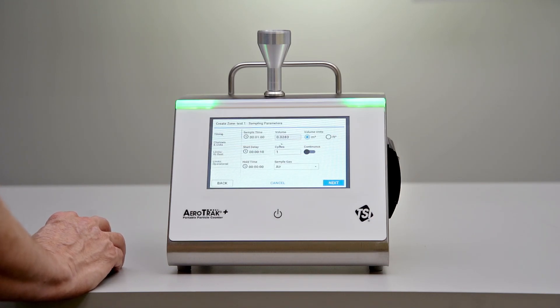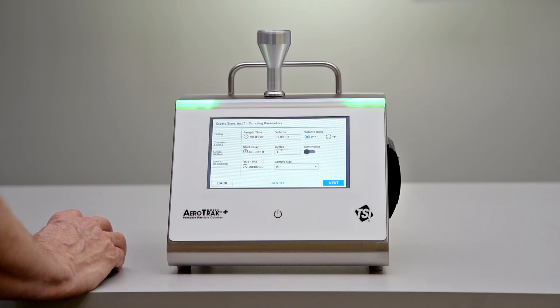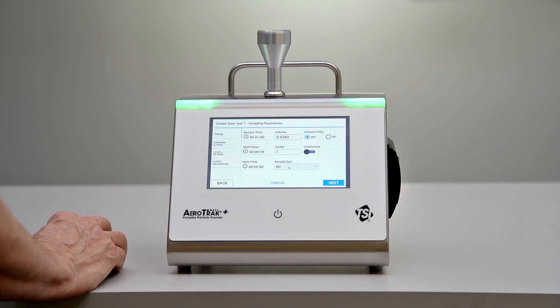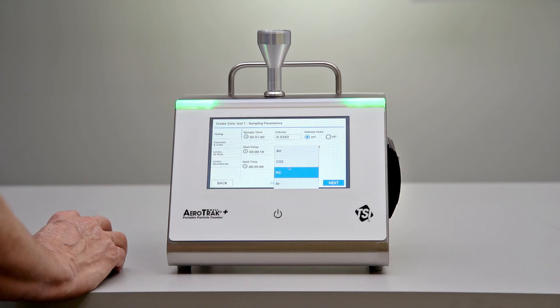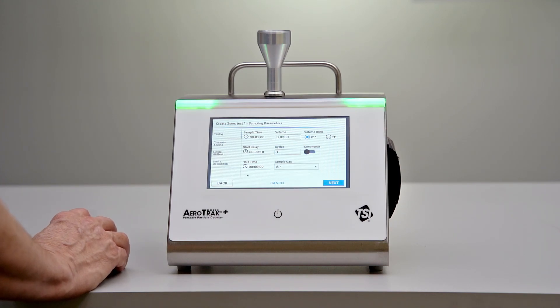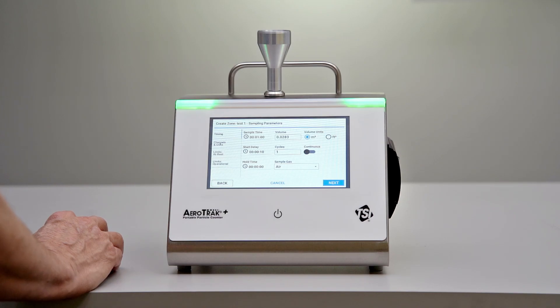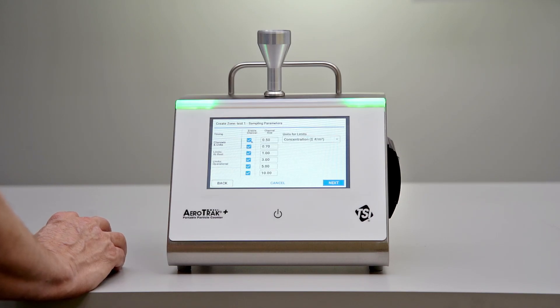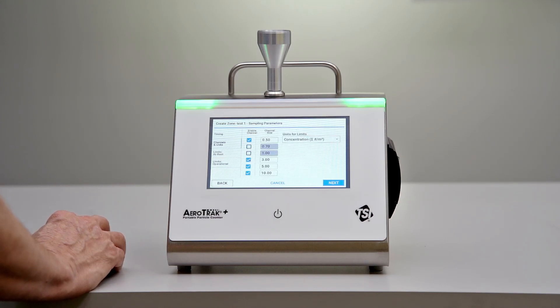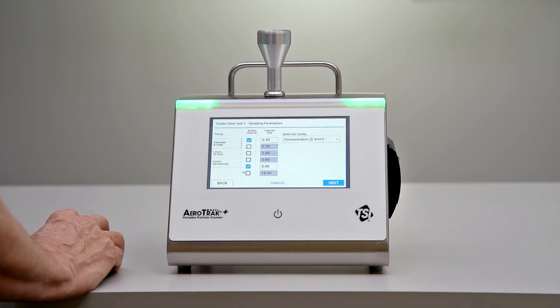Next, we select our sample parameters. We can change the sample time, volume, number of cycles, and type of sample. If we were testing, for example, a nitrogen line, we could pull that in and automatically correct for volume.